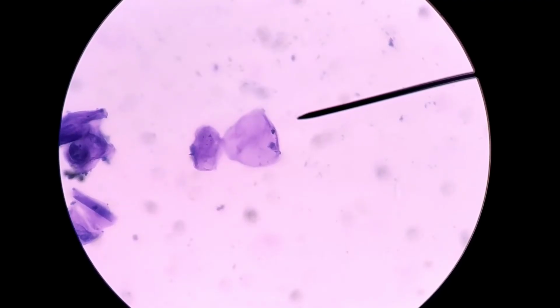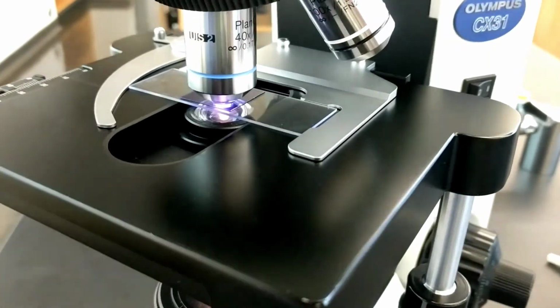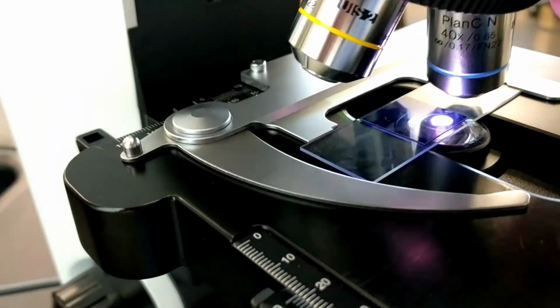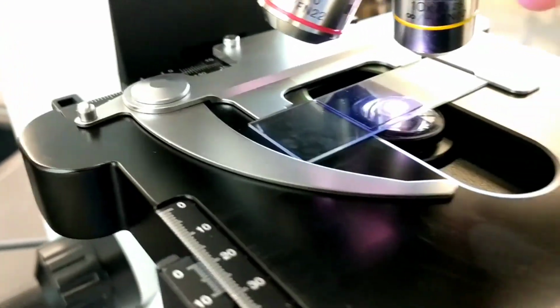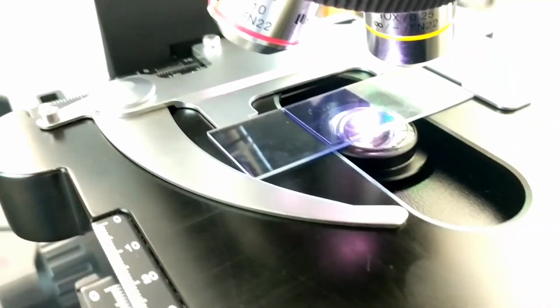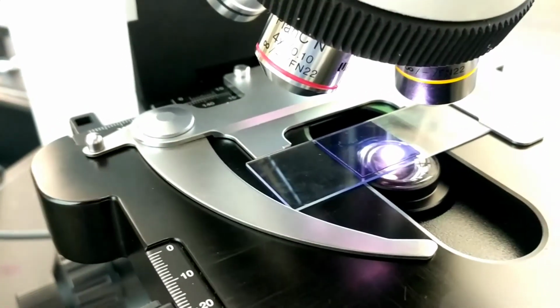All right, so we're back in focus under high power 400x, and I'm going to attempt to put the oil on. So we'll take this away and we'll look back down here. When you apply immersion oil, you have to make room to put the oil on. So I'm rotating the nose piece so that I've got some room to put the immersion oil on. And now I'm going to go ahead and use the glass dropper to apply a drop of immersion oil.